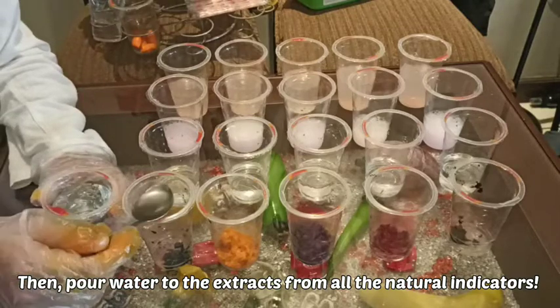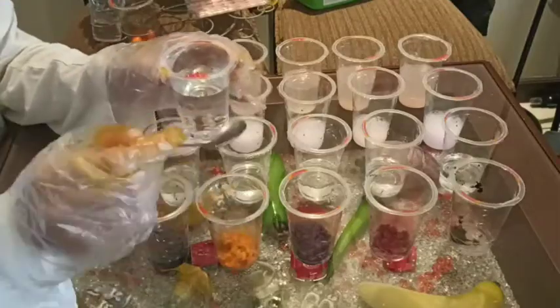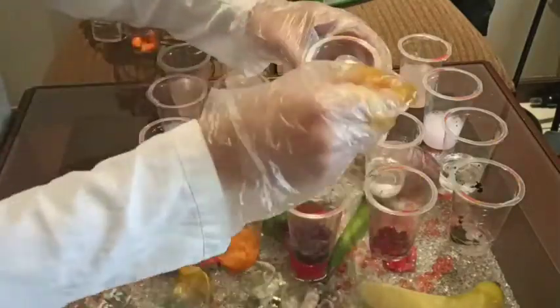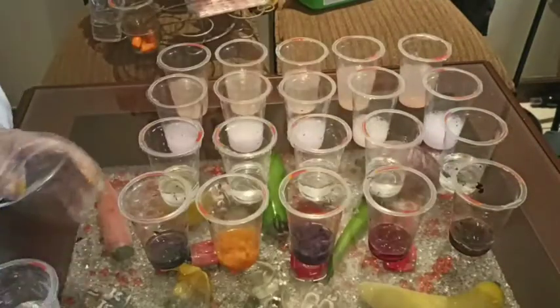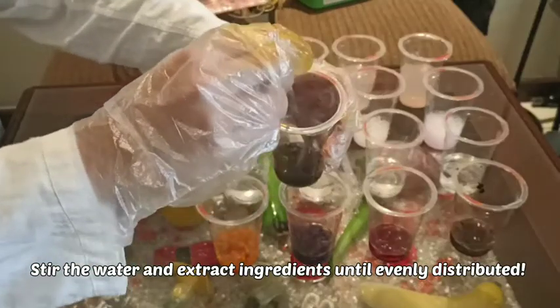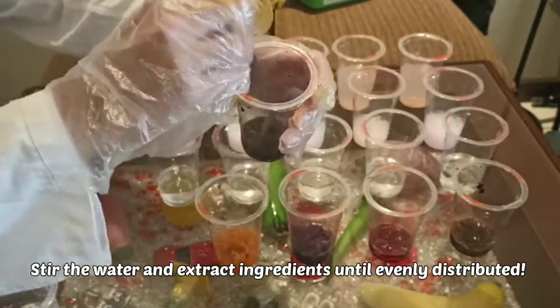Pour water to extract from all the natural indicators. Then stir the water and extract ingredients until evenly distributed.